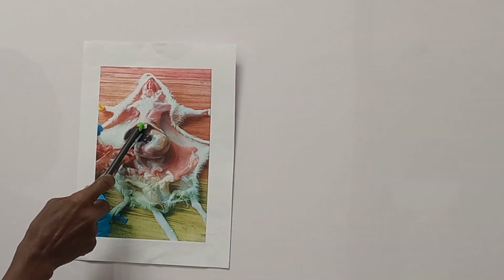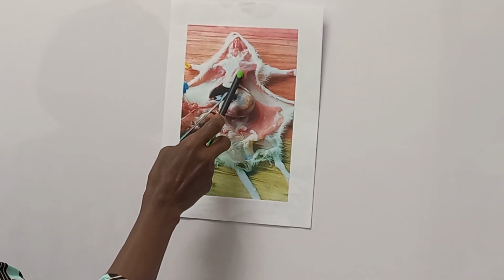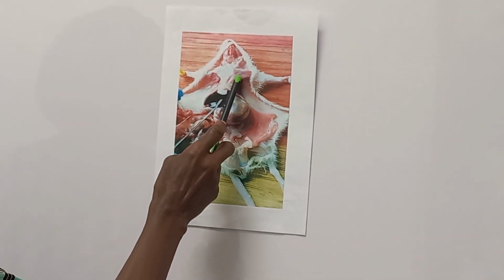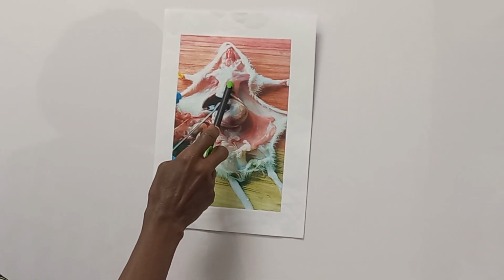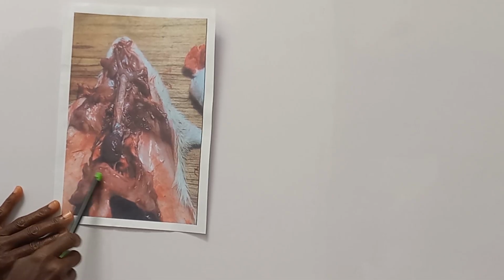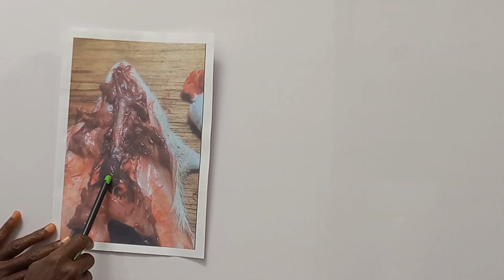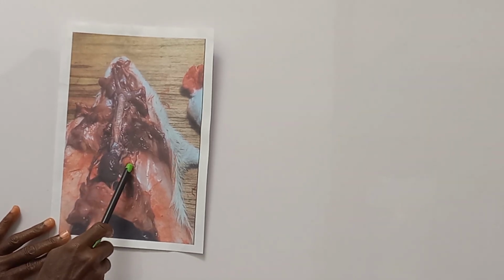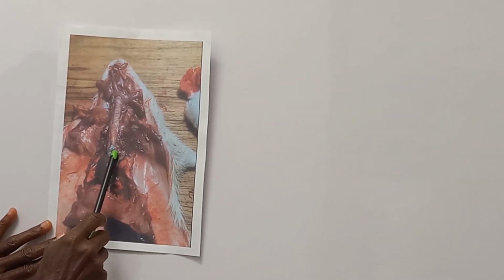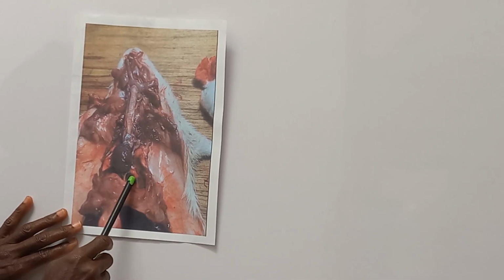Now, I want to look at the contents of the thoracic cavity. When the thoracic cavity is cut, the ribs here are cut, and the thoracic cavity opened. This is what we see. Here are ribs cut. Here is part of the ribs not cut. Here is the xiphoid cartilage. Here is the heart. Lungs are here. Here's a big blood vessel. Here is the aorta, and the vessels here, we'll have time to talk about them. But this is the thoracic cavity opened.